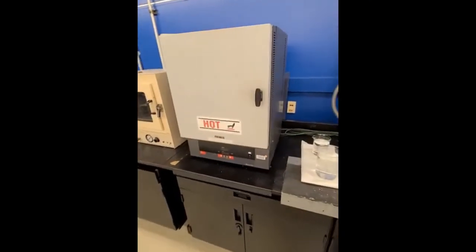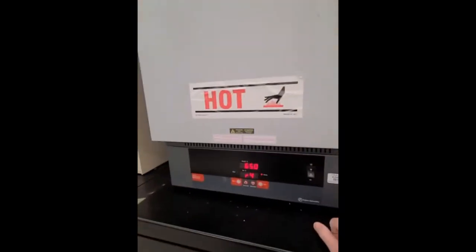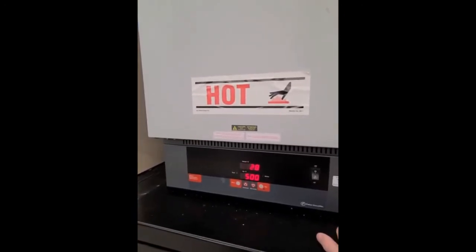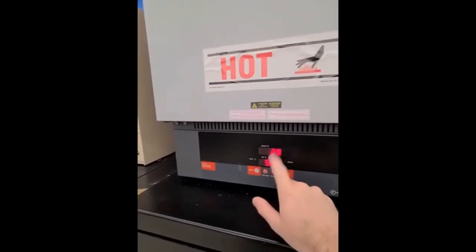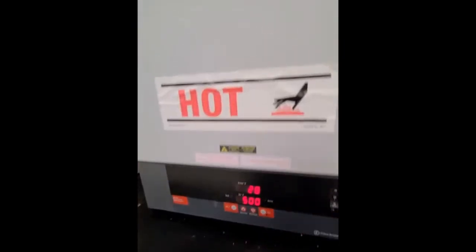Hi everyone, it's the next day. We're ready to make our tempered martensite sample. So again, we'll turn on our furnace. I had put it on this last night before I left. So 500 is our goal. This is going to start ramping up.